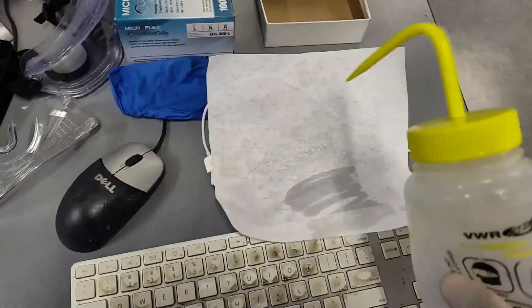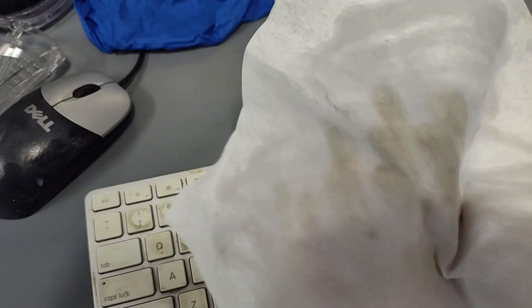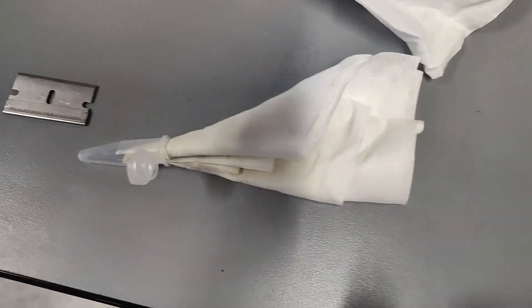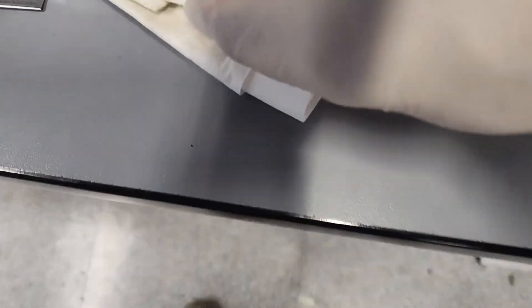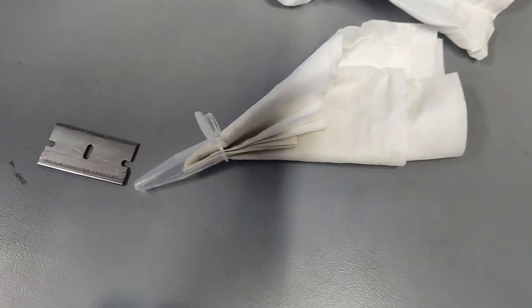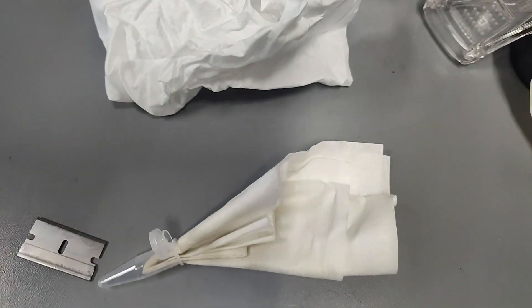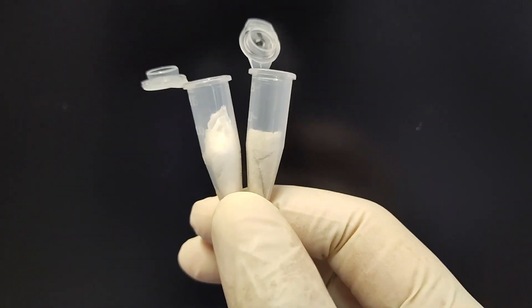Now we're going to try to clean this guy. It's getting pretty gross already — right away, getting gross. Wiped it all clean, went right in. And now we have a brown-tipped wipe — it's like a bunch of brown. I rolled it up into a tube and I'm going to cut it off with this razor blade. Same thing with the control, and we'll have two tubes — one clean, one not.